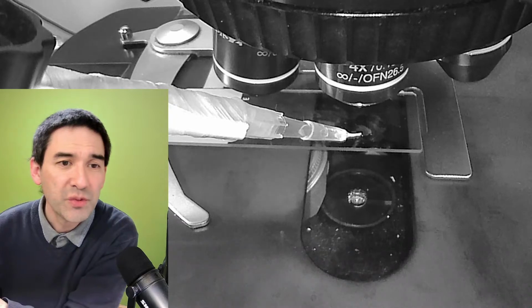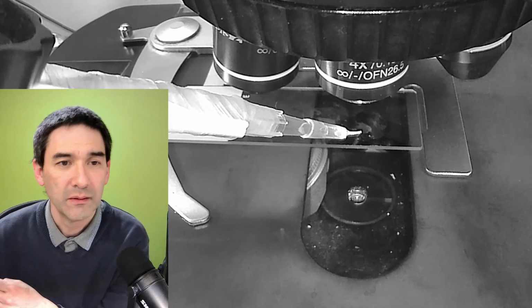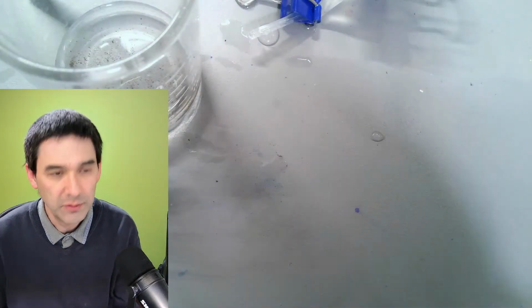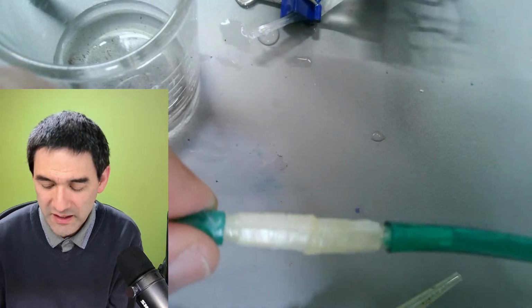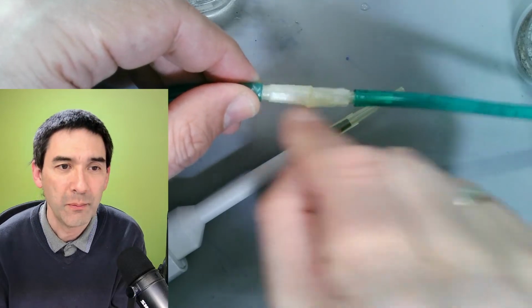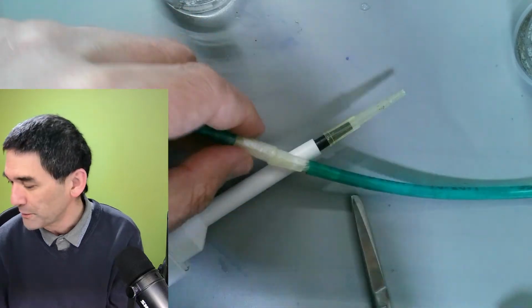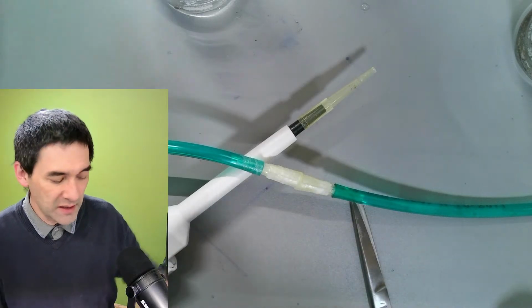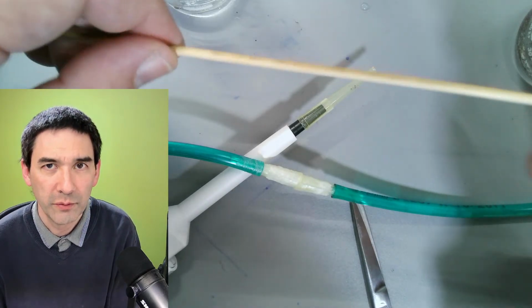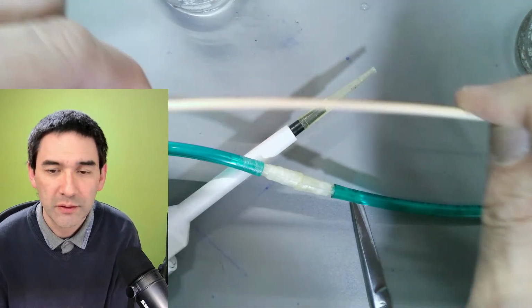On the stage. The camera is switched now back to black and white because this camera will adjust itself automatically. So this is a little bit the system that I used. Over here on the desk view, look, I only had small pieces of this air tubing, and I also connected it together using parafilm and also some pipette tips that I melted together. Okay, so it looks like a chopstick. It's not a chopstick. What I used are these sticks here that are used if you, for example, want to put meat on here for, I don't know, some chicken or some meat for cooking. So that's actually made of bamboo, and they're quite solid.